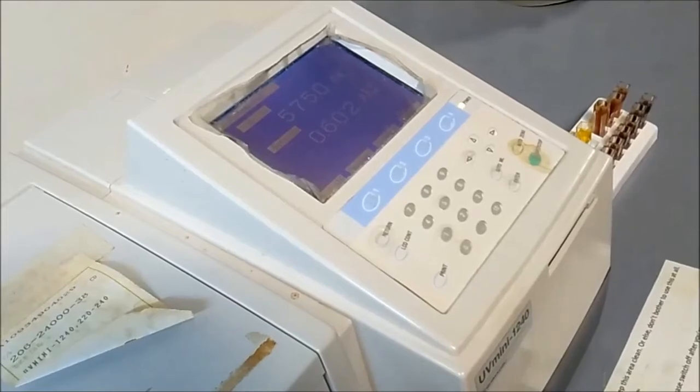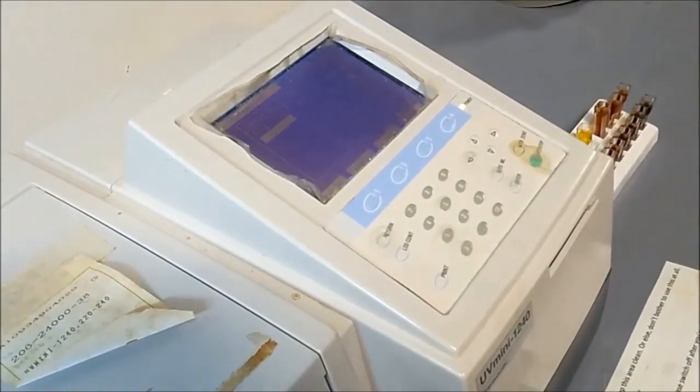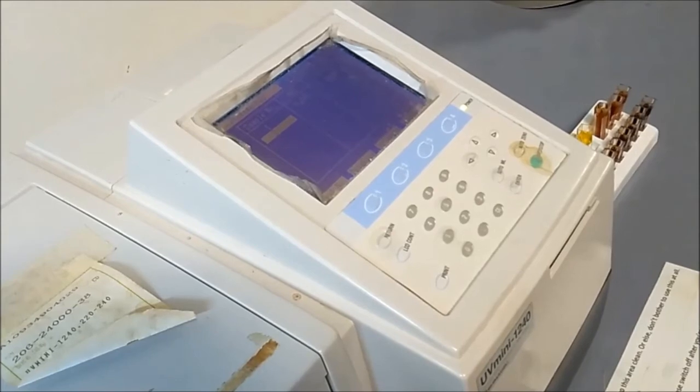Then, press start and record the absorbance reading obtained.